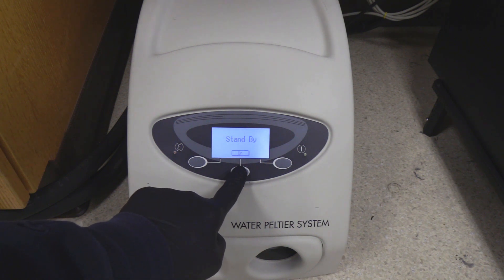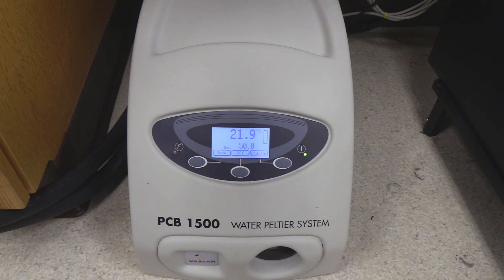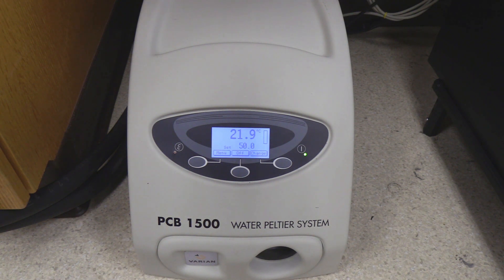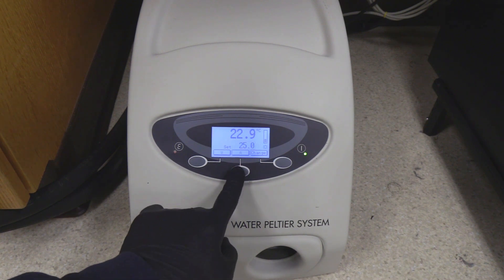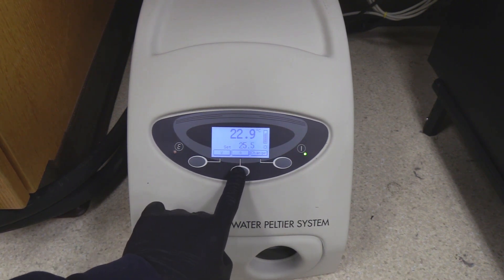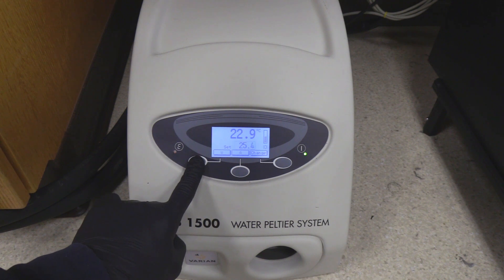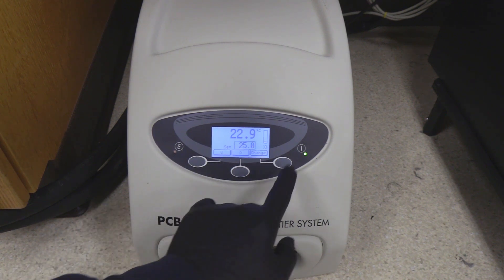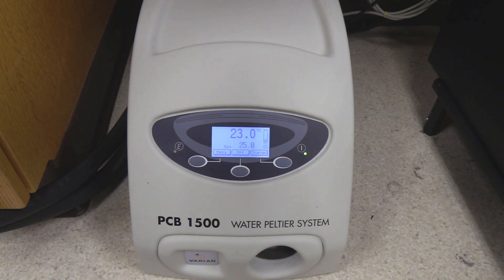Press and hold the on button until the display shows the temperature. The large font size number is the current temperature and the smaller font size number is the desired temperature. Press the right button to change the desired temperature, the middle button to change the temperature up, and the left button to change the temperature down. Once the desired set temperature is reached, press the right button to set it.